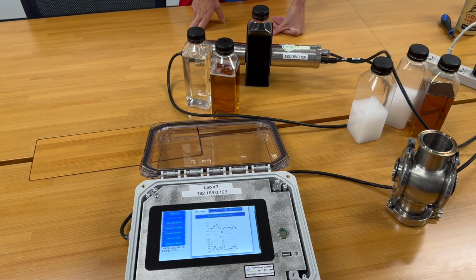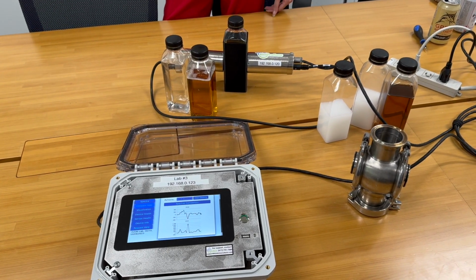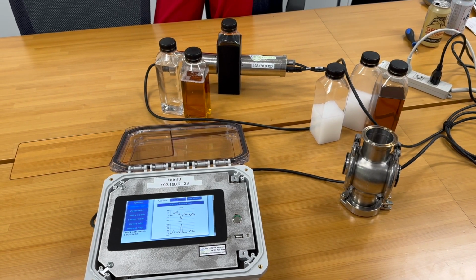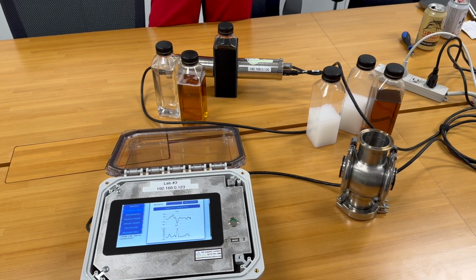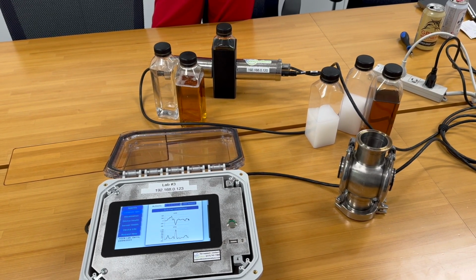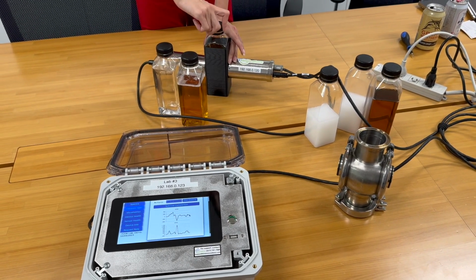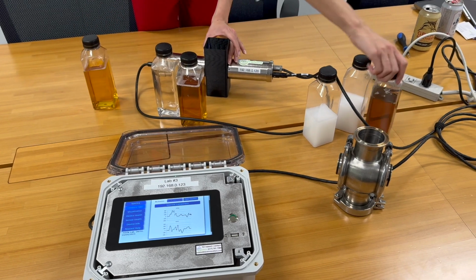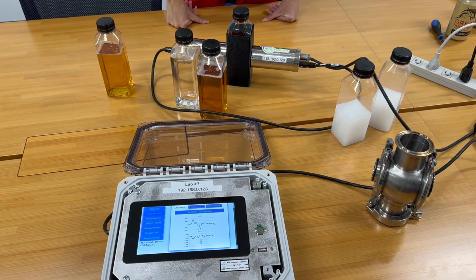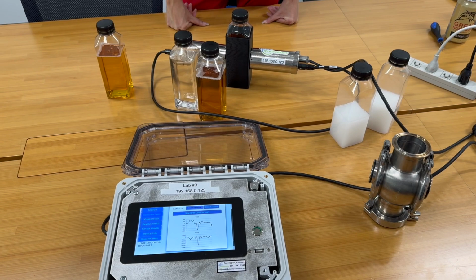And so now you can automatically transition when you reach fully water, and your water push into your next beer, you reach a good quality, it detects that, communicates with the PLC, and then sends this to the filler instead of sending this to waste, improving product quality to make sure we're not batching bad quality, but also reducing product loss. Now, let's put this to the test as well. You can look at different products. So for example, this is tea, different material. This is the difference between beer 1 and tea.